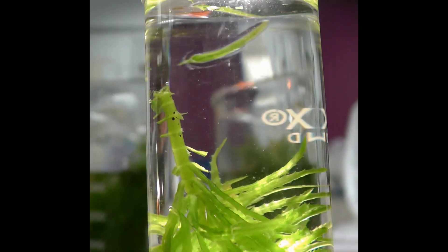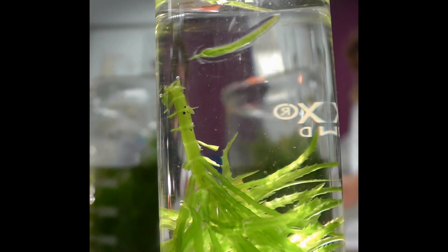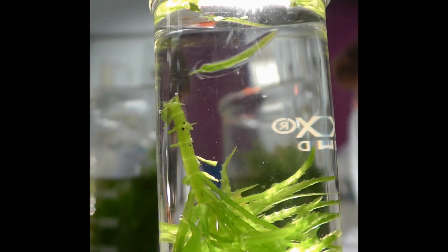At this stage students can adjust the lamp until they see a stream of bubbles. If no bubbles appear try cutting the stem again.